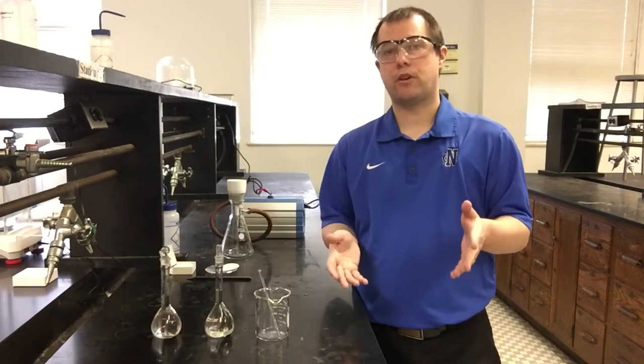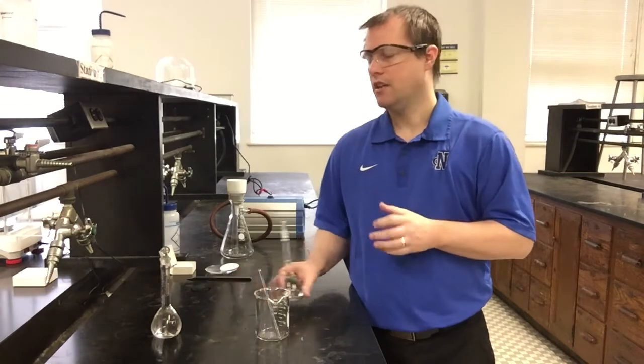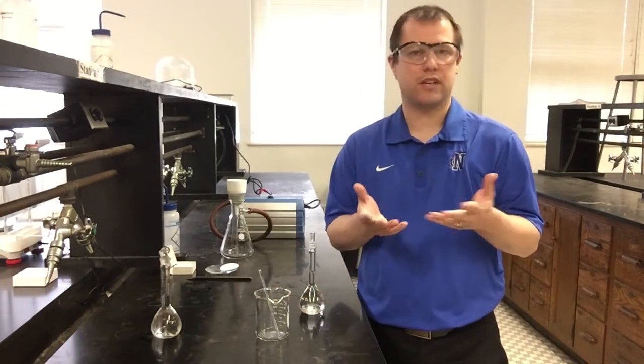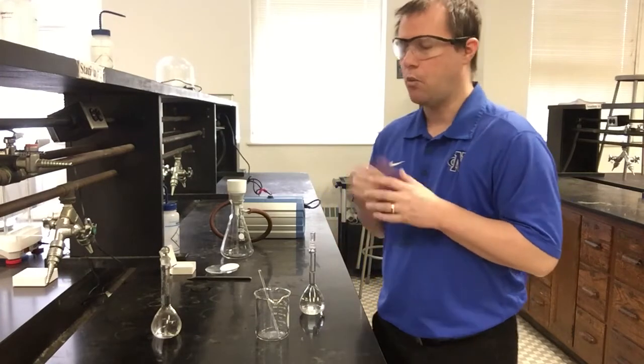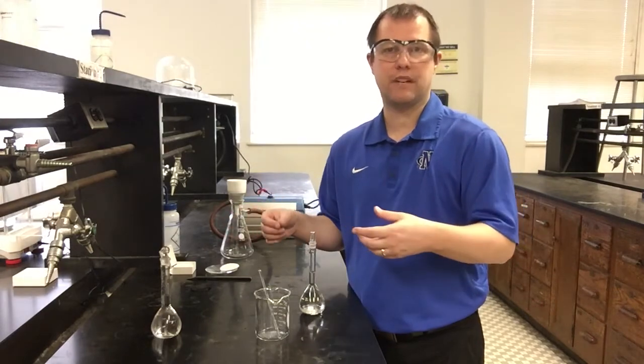All right, so for the third part of this experiment, now we're actually going to do the precipitation reaction itself. We have both of our starting reagents ready and prepped. We made their solutions. They're the right concentrations. So now we're ready to go ahead and mix these things. I'm just going to mix them in a beaker. You could do it in an Erlenmeyer or a beaker. It doesn't really make much of a difference what you exactly mix them in. It also doesn't really matter the order or how you start out mixing these two things.